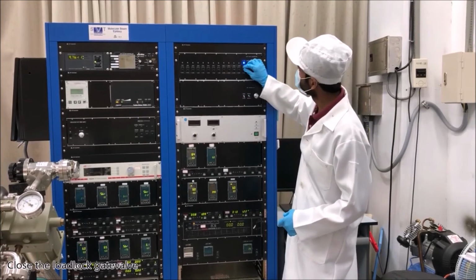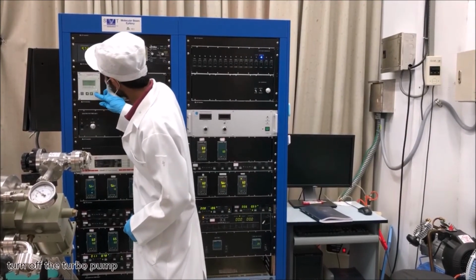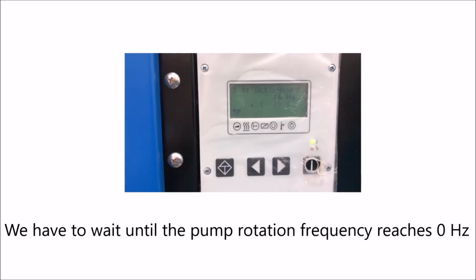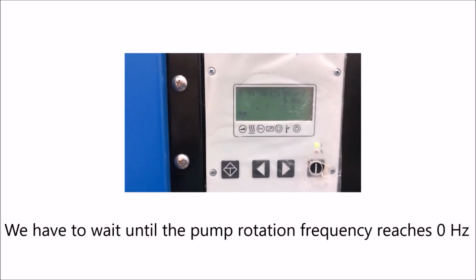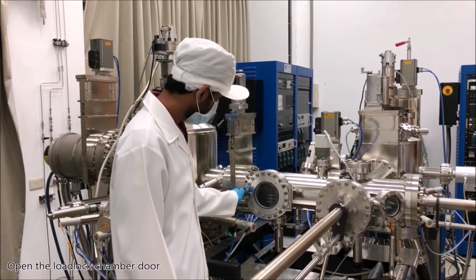Close the load lock gate valve. Turn off the turbo pump. Open the load lock chamber door.